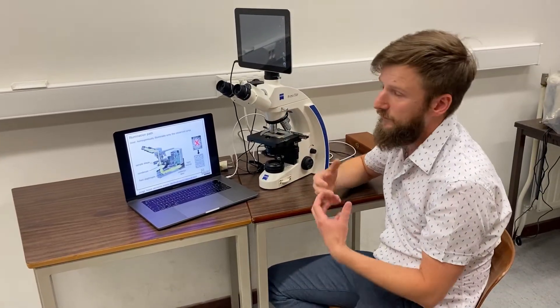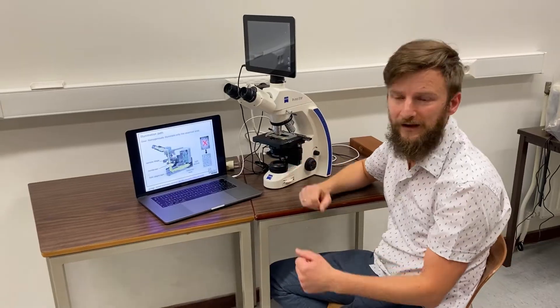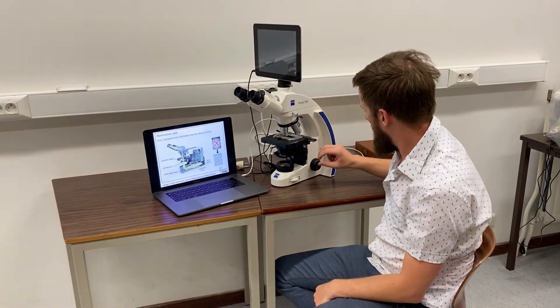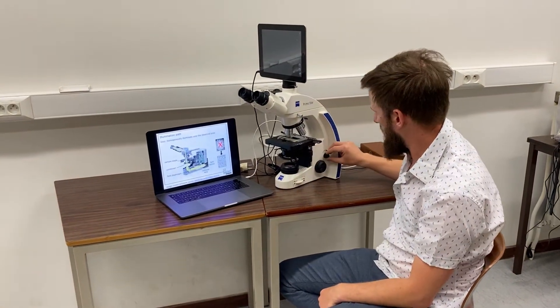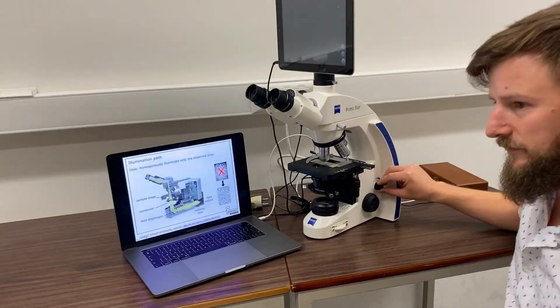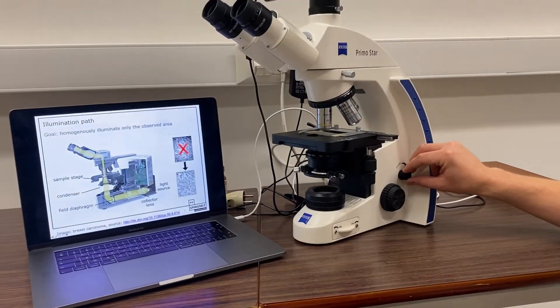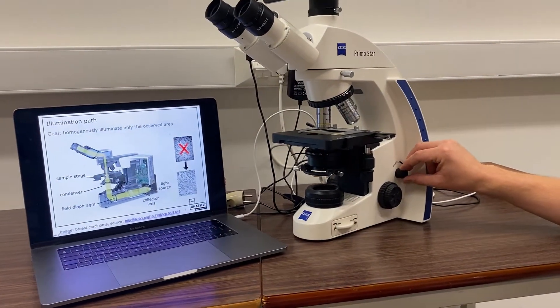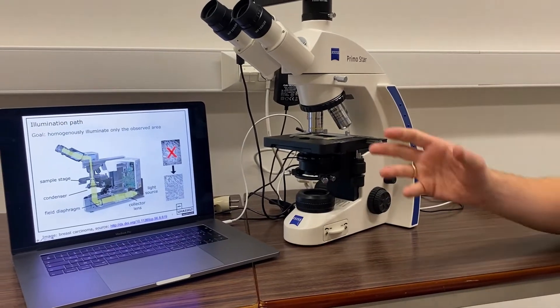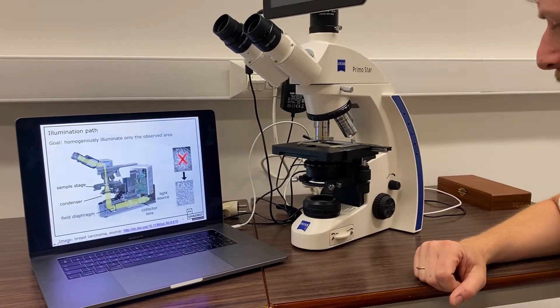It can also cause toxicity if you're working with live samples. This knob over here is used to turn the microscope lamp on or off, but it's also used to regulate the intensity of the illumination at the sample.